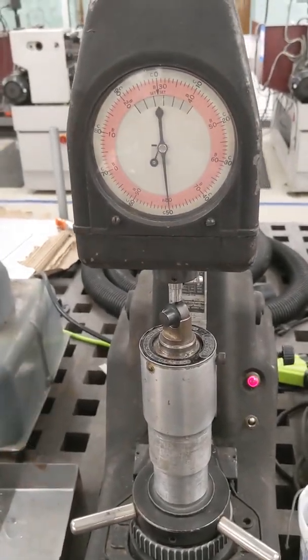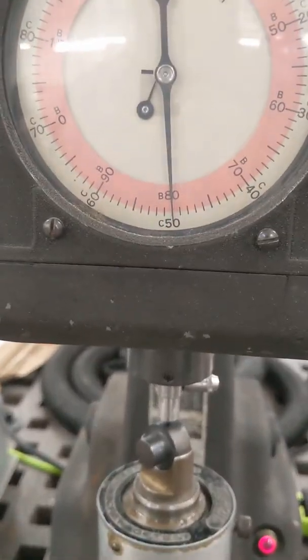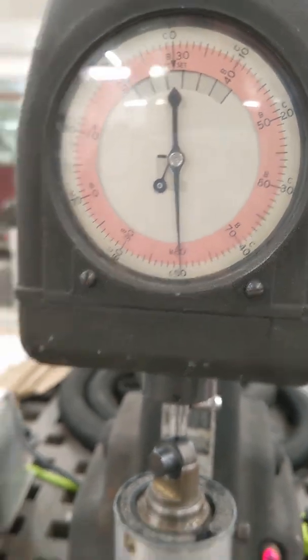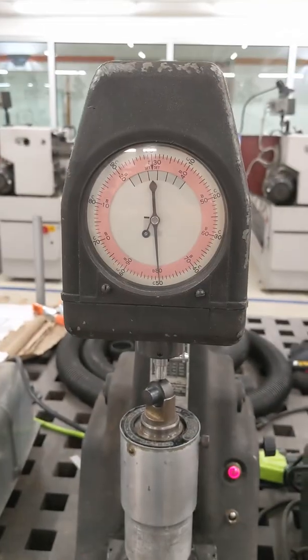It applies load, holds it for a second, removes it, and then springs back and I get a reading of 50 again. I got a reading of 50 both times, so I can be pretty confident that that's the hardness of this piece of material.